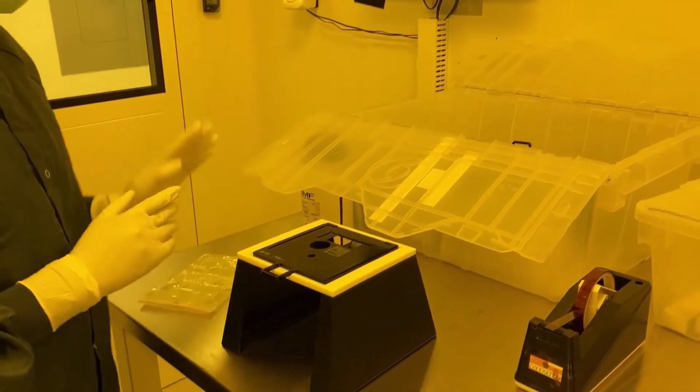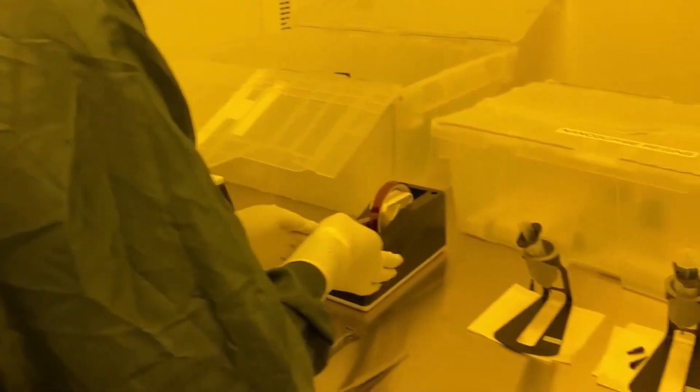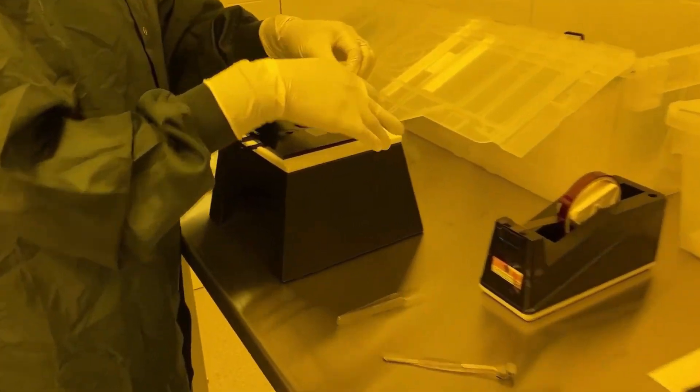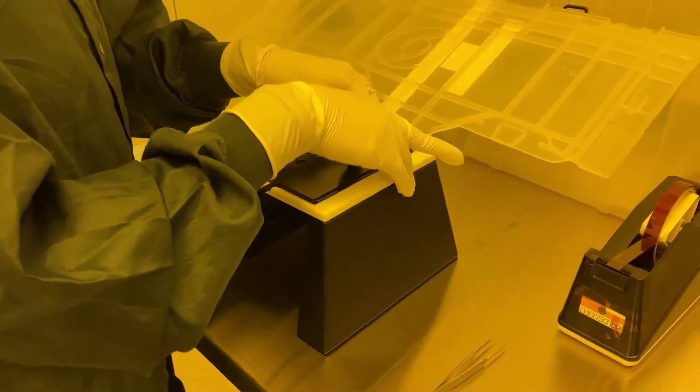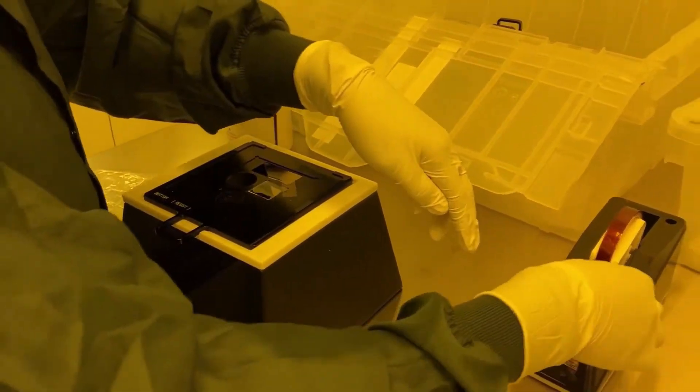Once you have the correct side, secure the substrate down using the Kapton tape next to the resists. This will keep the substrate in place.